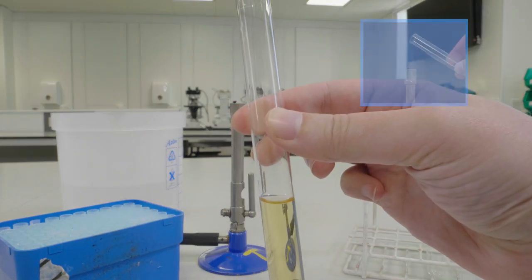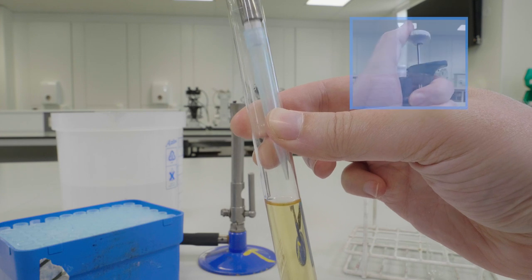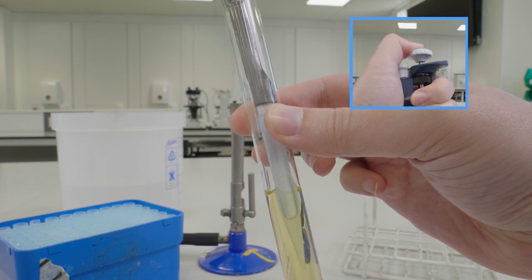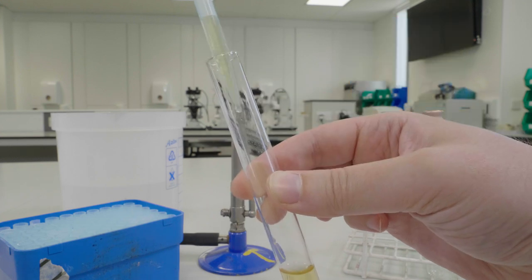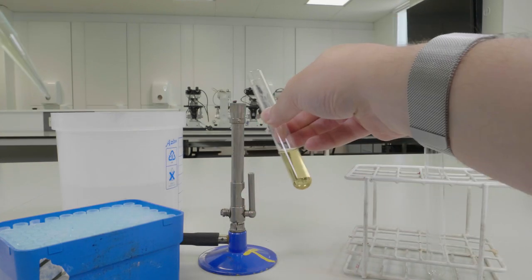Take your pipette, put it into the tube and push down on the pipette plunger to the first stop. When the tip's in the liquid slowly raise the plunger of your pipette to take up an aliquot of culture media.